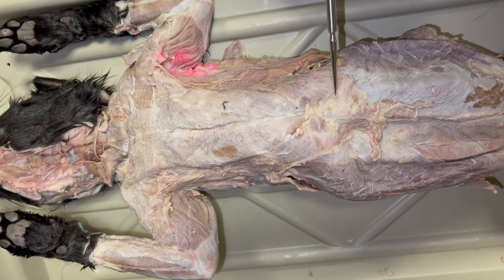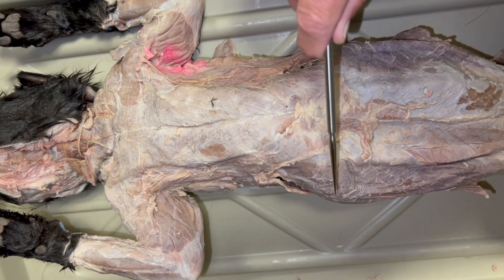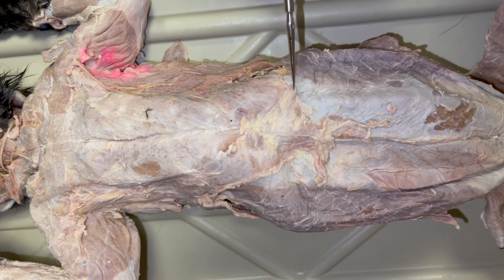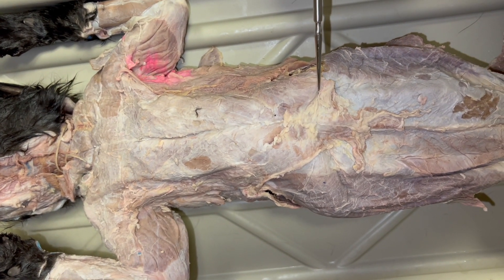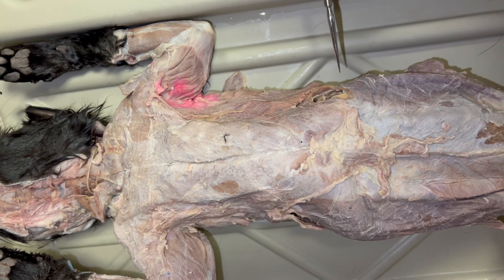You'll be making a deep cut, cutting through everything until you get into a body cavity. You want to do it across this way so that you catch a little bit of the point of that xiphihumeralis. So you'll be cutting across about here, and then when we come back I will have done that.